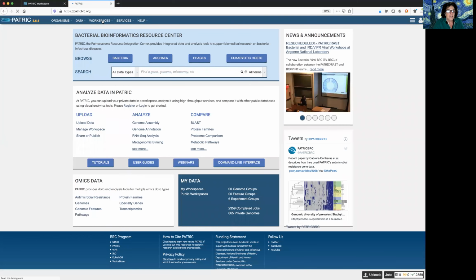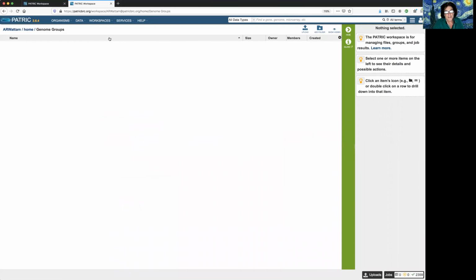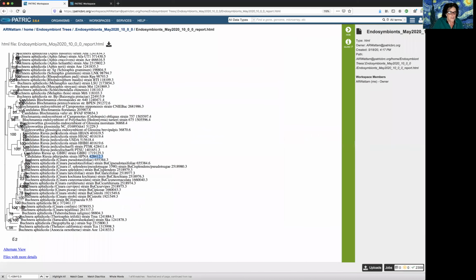And this time I'm going to go into my workspaces and click on my genome groups. I have a bunch of genome groups. I use them all the time. They're the easiest way to assemble data and launch jobs. And so I want to go to the ones I've recently created. So I'll double click on this and this will show me the most recent ones. The problem, I'm going to go back to this first tab, were with these Riesia genomes.